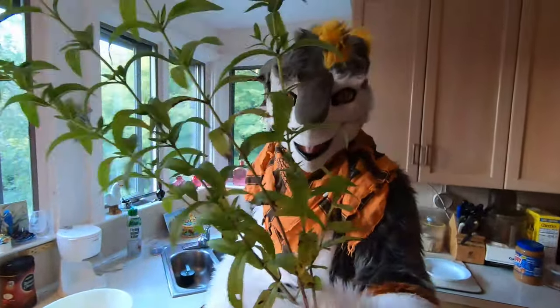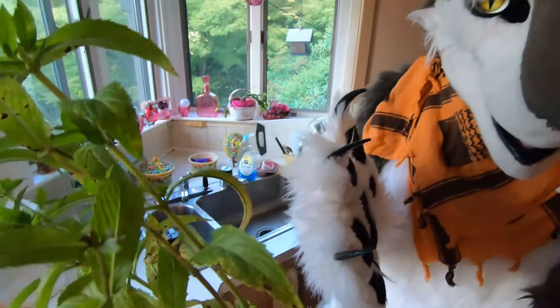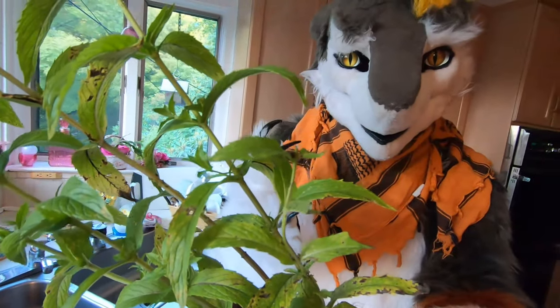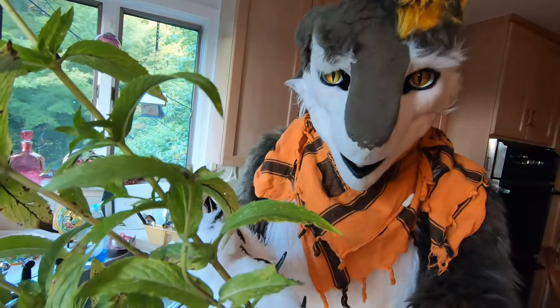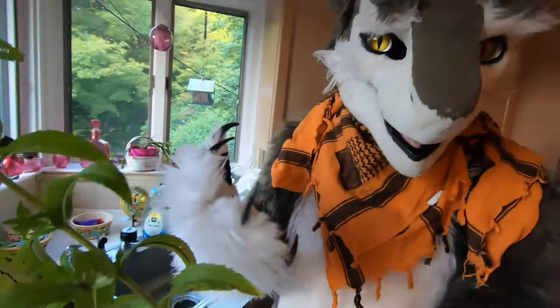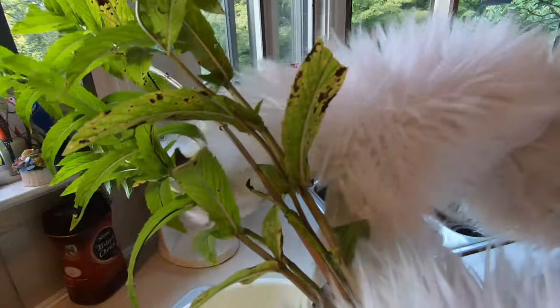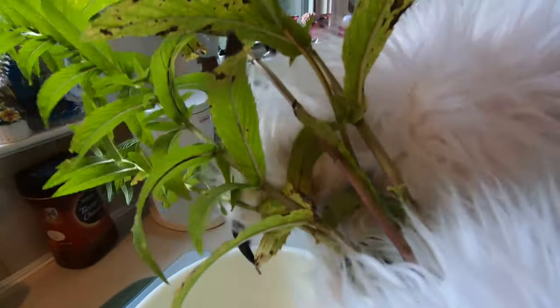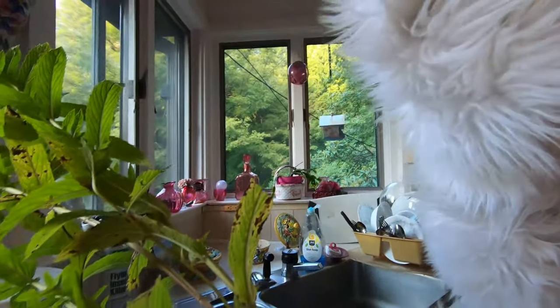Now that we've collected our herbs, we want to take the leaves of the mint — not so much the stems. There are little pods on the underside of the mint leaves, and that's what contains the essential oils we're trying to extract. We're just going to pick all the leaves off, collect them in this bowl, wash them, and then put them into the biomass flask. It's actually good if the leaves get a little bit messed up while doing this, because roughing them up — even cutting them — gives more surface area for the steam to hit and access those essential oils more easily.